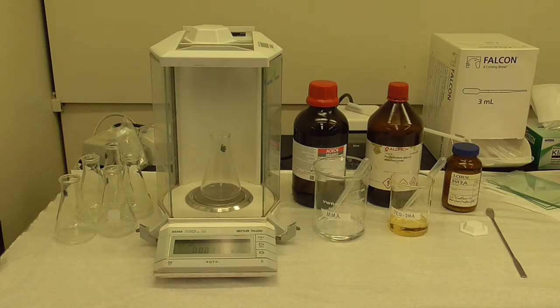Methyl methacrylate, the stock bottle is poured out into the beaker in front. Next we have polyethylene glycol dimethacrylate and finally the photo initiator DMPA.